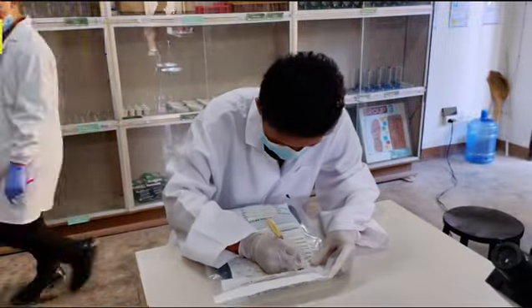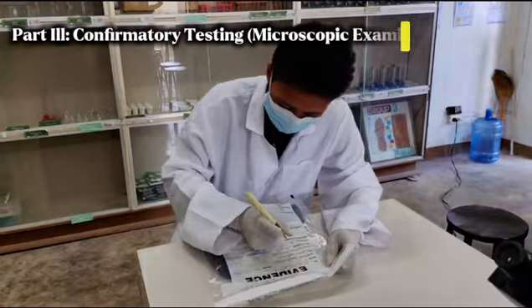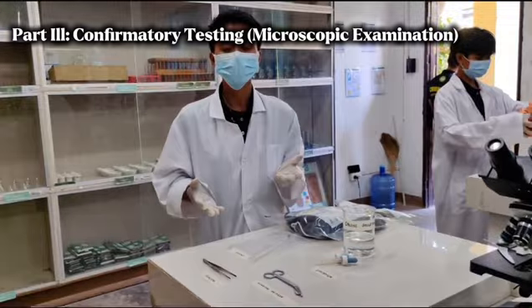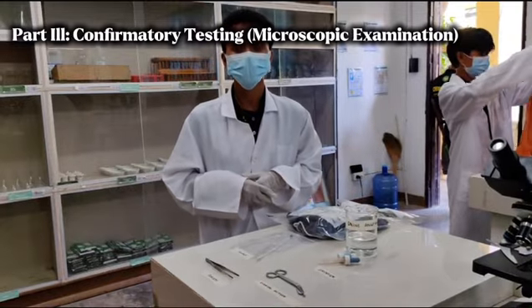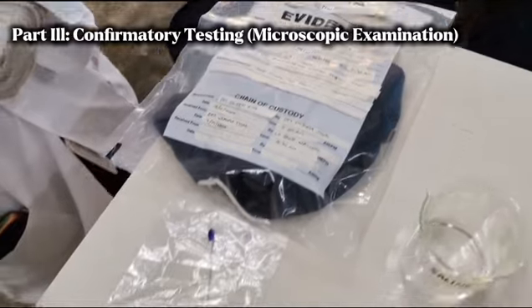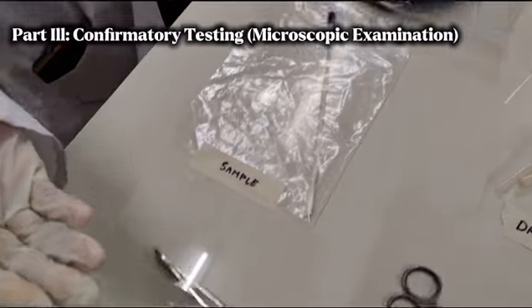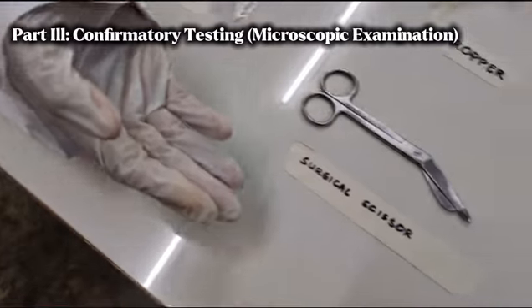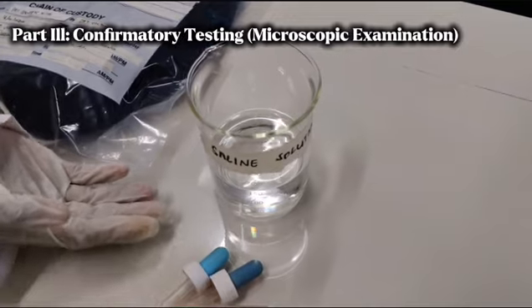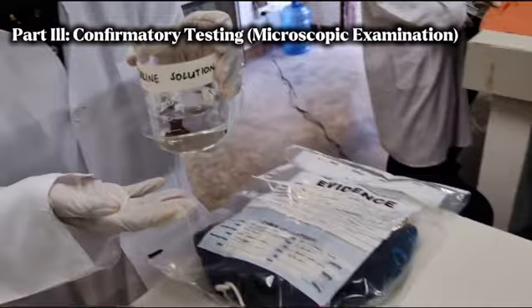Now we are proceeding to the confirmatory testing or microscopic examination. Here are the things that we will be using to conduct a confirmatory testing or microscopic examination. The evidence bag, sample, forceps, surgical scissors, dropper, and our saline solution.